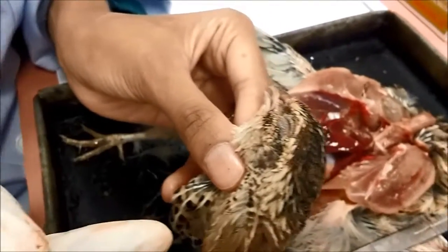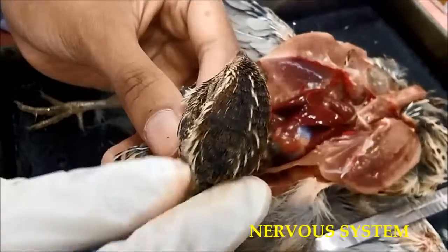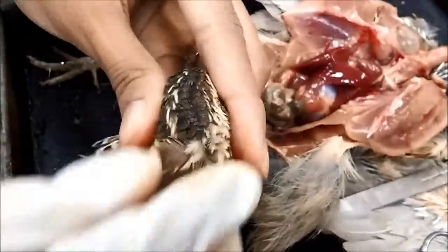So now we are going to see the nervous system of the bird. So first thing that we have to do is remove the skin and the feathers from the head. So first I'm going to remove the feathers.